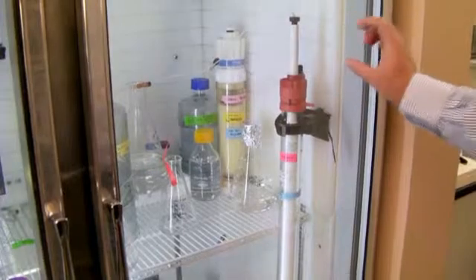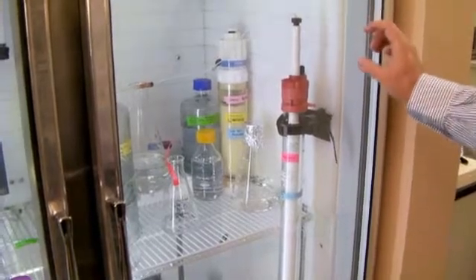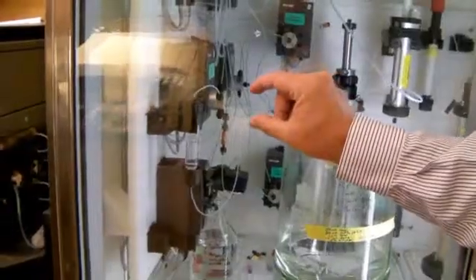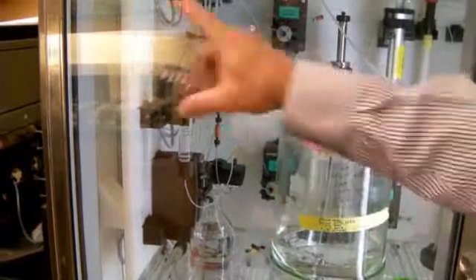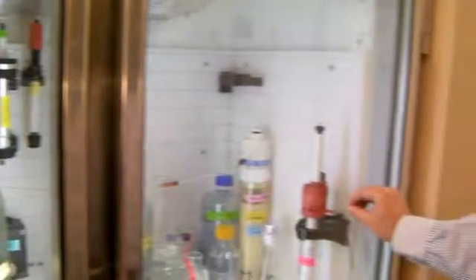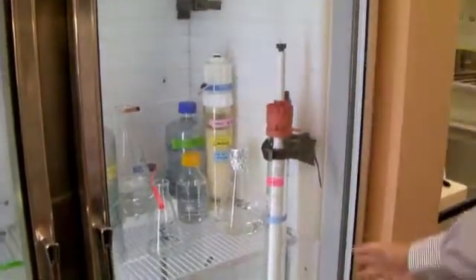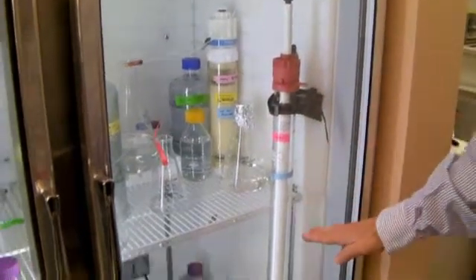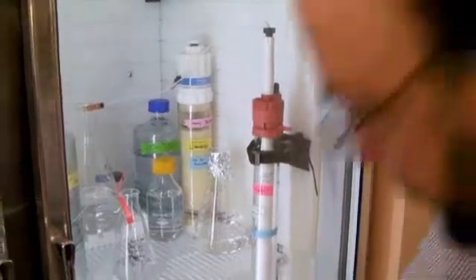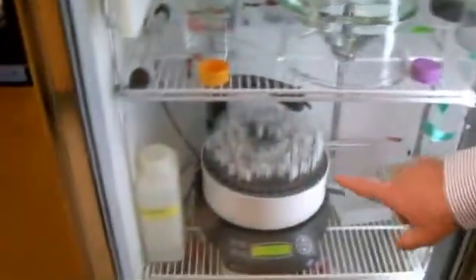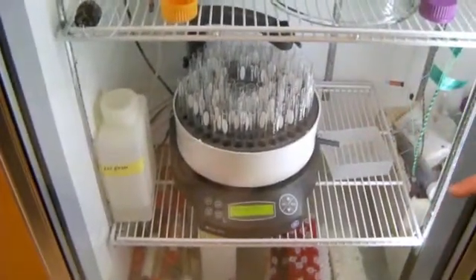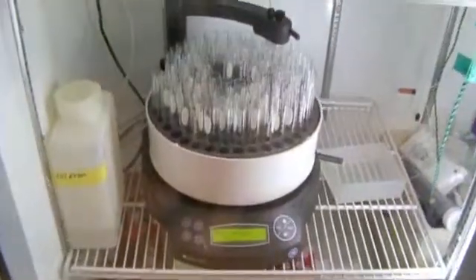What we've done is we've put a solution of our protein that we want to purify that still has some other things with it, so we want to separate our protein of interest away from the other stuff. In this case, we put 5 mils of our sample of protein into this little tube. The pumps from the machine drive it through the tubing over onto the top of this column. It goes into the column, and we keep running a buffer solution continually through it, and the proteins actually migrate their way down through the column. The solution's going to come down and then come over, and we're actually collecting fractions. This machine has a bunch of individual tubes for fractions, and it's going to collect a certain volume and then move to the next tube.